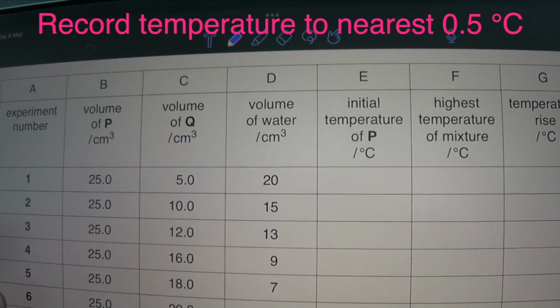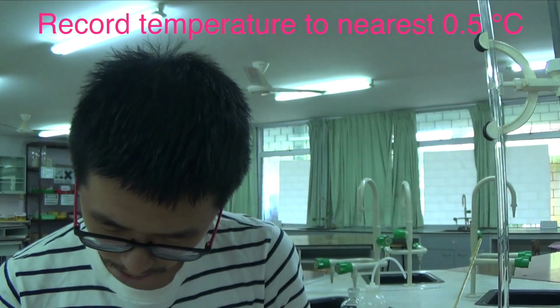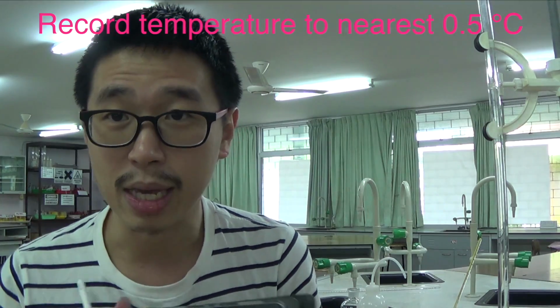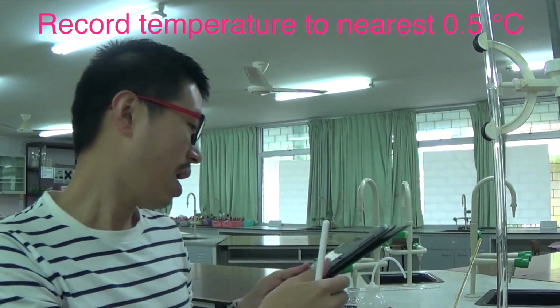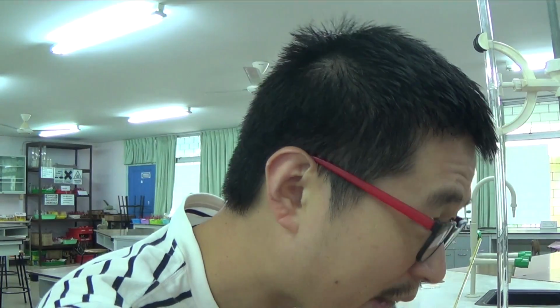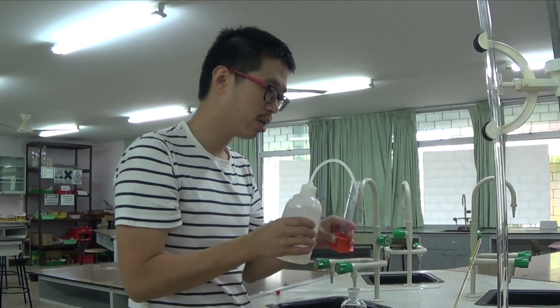But what I have is initial temperature. Initial temperature just now was 22.0 degrees Celsius. Initial meaning at the beginning. So that's why I fill in 22.0 degrees Celsius there. I am now going to add some distilled water because what they want me to do is measure 5.0 cm³ of Q into a measuring cylinder. So I have a measuring cylinder. I should wash this with some distilled water.